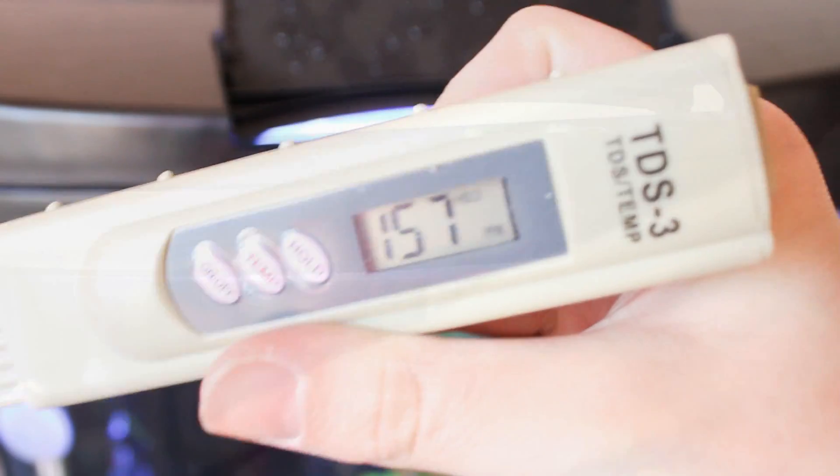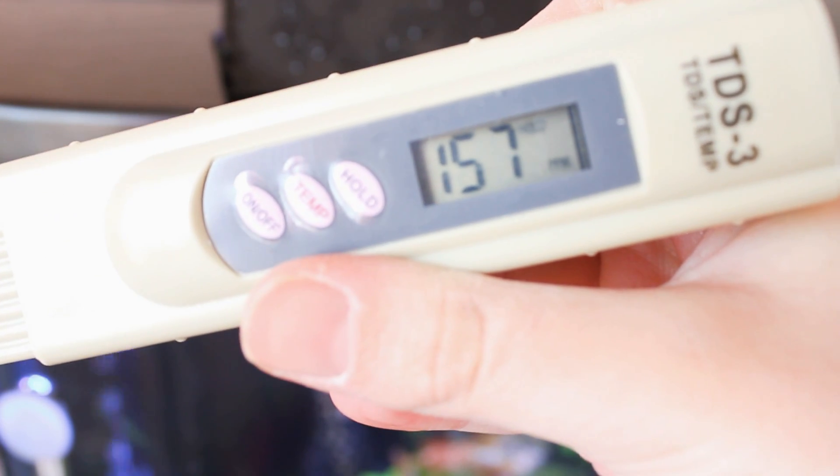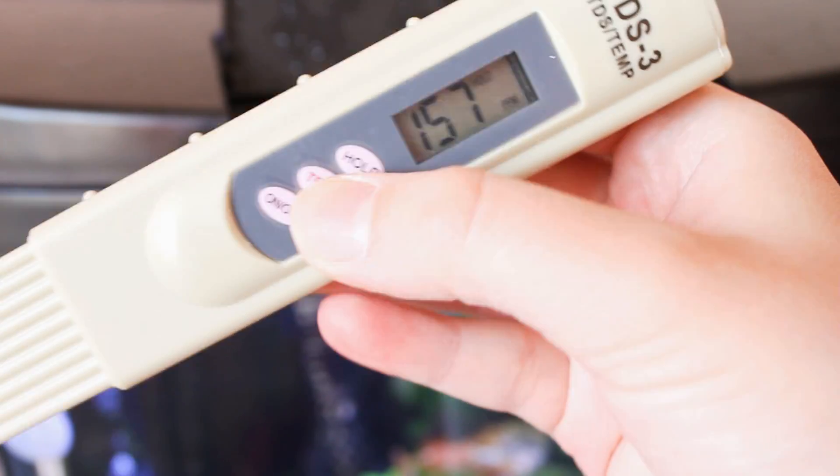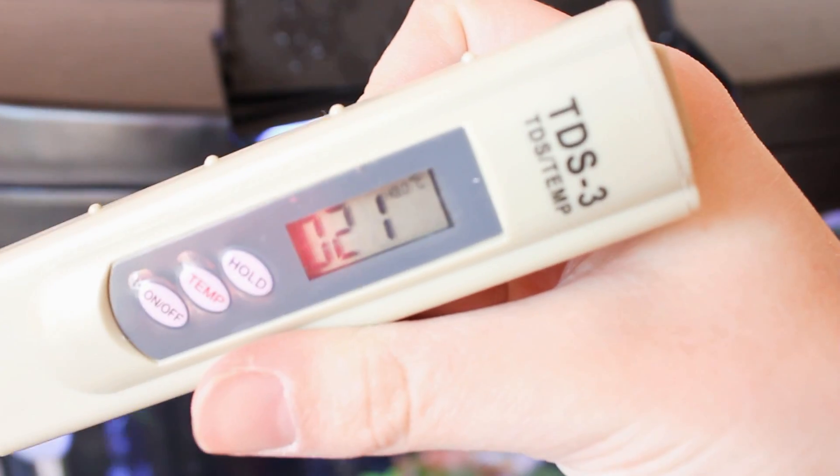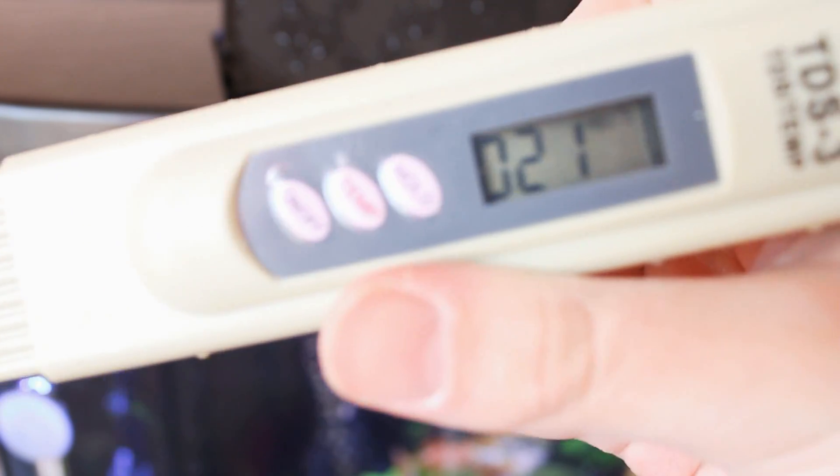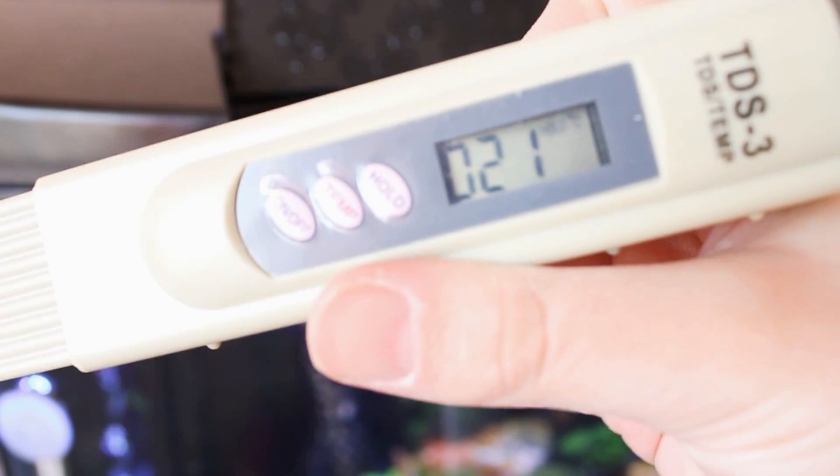I don't exactly know what that means in terms of is this good or bad. It might be something to do with the fact that the water originally was hard water. It can also apparently take the temperature, so it's saying 21 degrees. Ideally I could set this a little bit warmer because I've got snails coming soon and I think they need it a little bit higher.